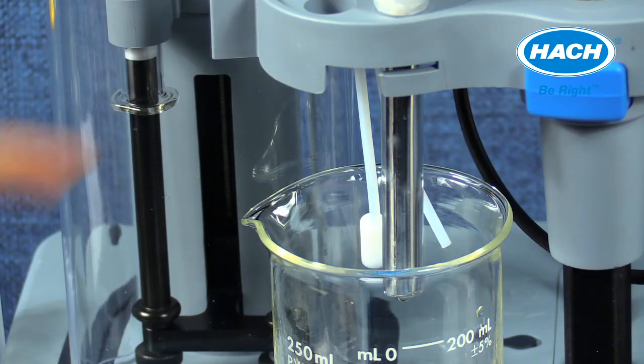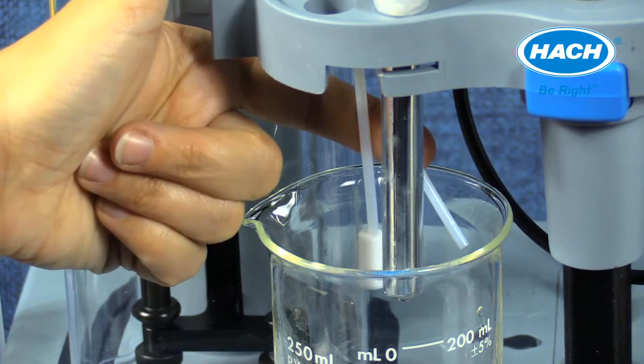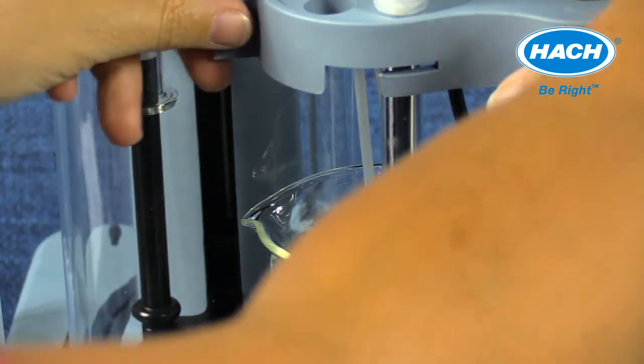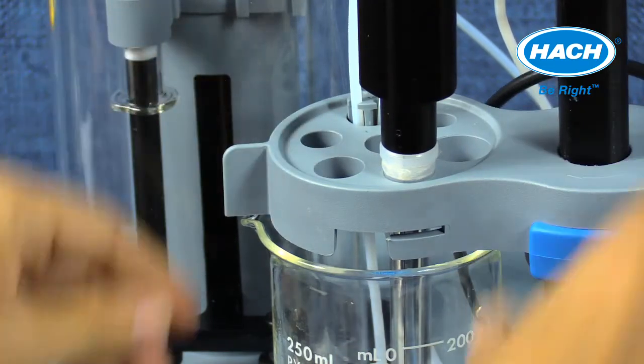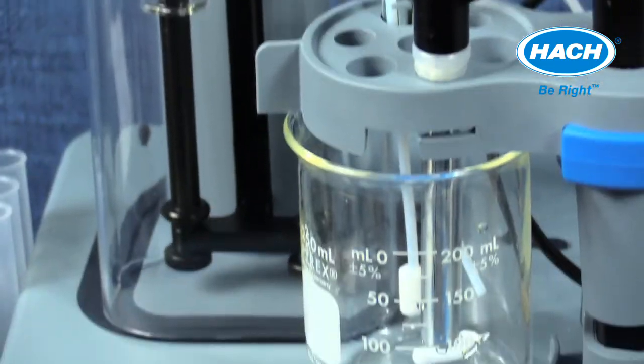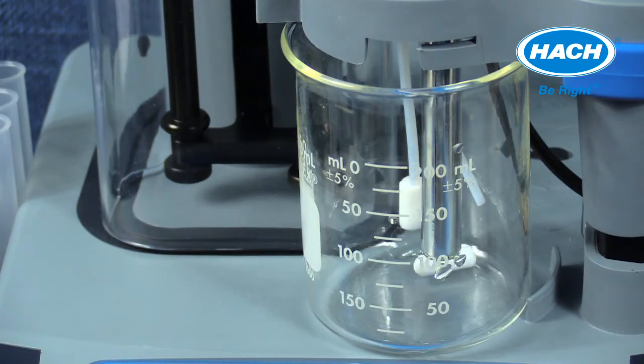Orientation of the tubing and electrode in the sensor holder is important to note. The tubing and the electrode are orientated across from each other in the sensor holder. The anti-diffusion tip is about the same depth, about 5 to 10 millimeters above the stir bar in the sample beaker. The reagent tubing from the pump is at a higher level, just above the surface of the sample. Using an empty beaker will assist in setting the correct tubing and electrode orientation and depth.